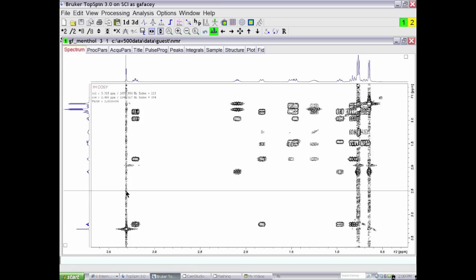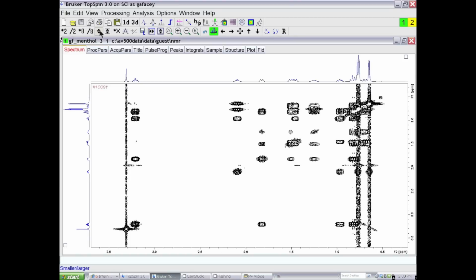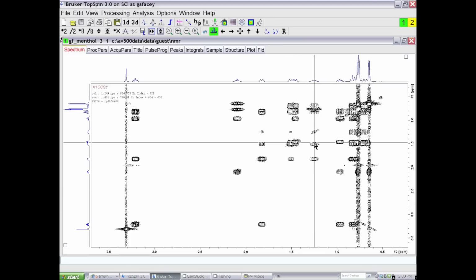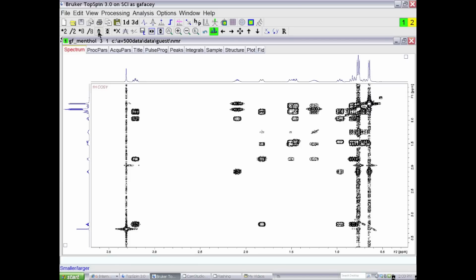The way we go about doing this intelligently is you should scale your data set before you symmetrize it. Pick the smallest real off-diagonal response and then scale the data so that the smallest response is just on scale. I'm assuming that the smallest off-diagonal response is this one that's symmetric with this one, and I'm going to scale the data set so that that's the smallest response. So on this scale, we can still see these stripes of T1 noise.